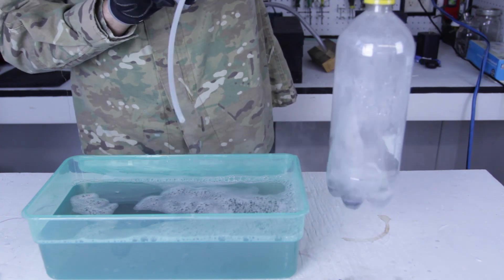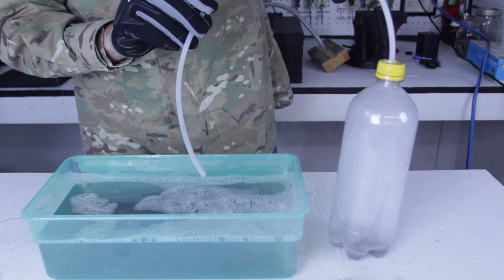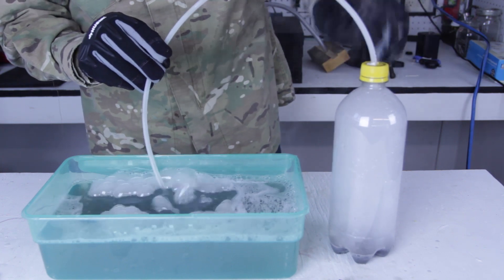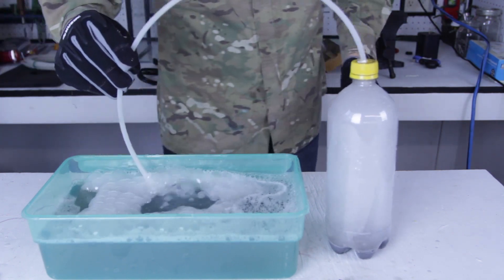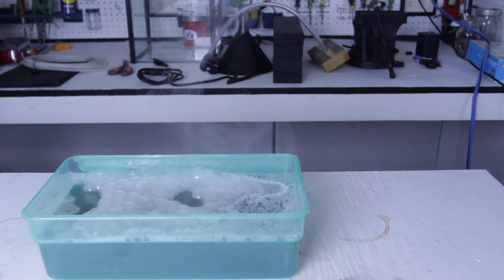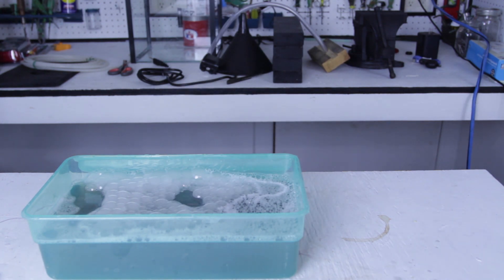As you can see, it's creating fumes. They're going to go up the tube. I'm going to make a bunch of bubbles. Put this away somewhere. So now I'm going to light those bubbles up and see what happens.